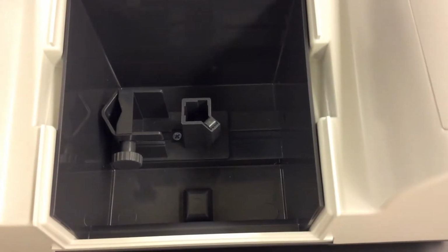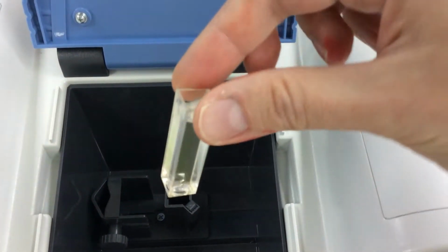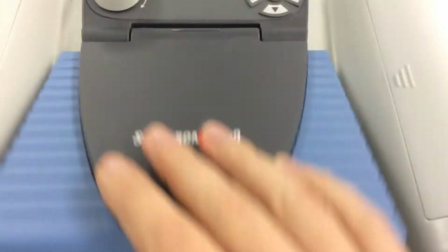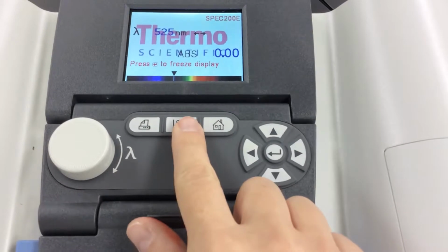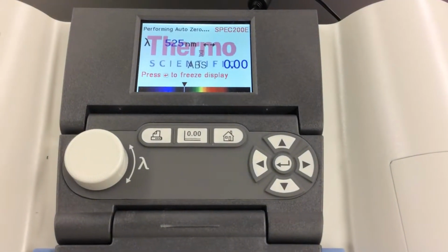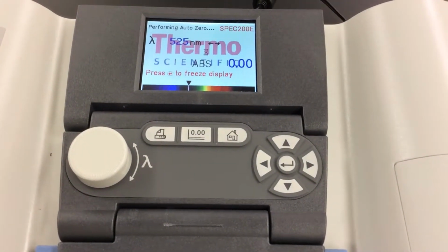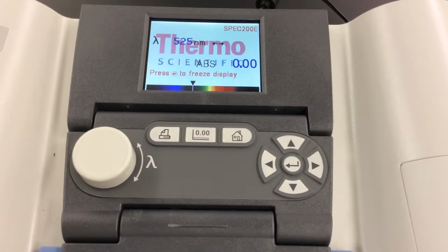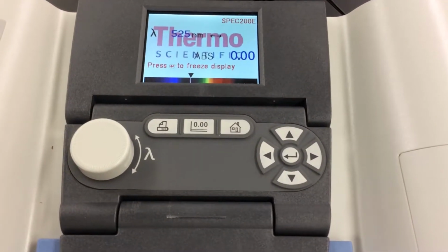So this is what the inside of the instrument looks like. We take our cuvette and we place it in so that the little notch is pointing that way. We close it. We've already set the wavelength to the wavelength we want, so now we just hit 0. And then the instrument takes a reading, and it's saying, okay, this is my baseline. So now the instrument knows what 0 looks like. So we wait patiently. Okay, now the instrument says, all right, here's my baseline. That's what plain water looks like.